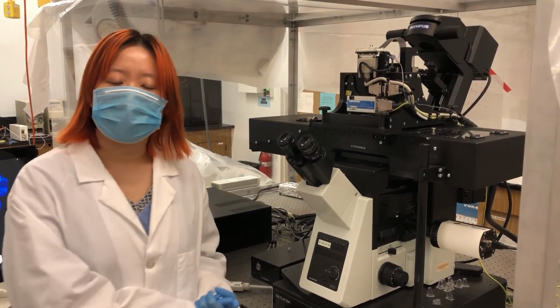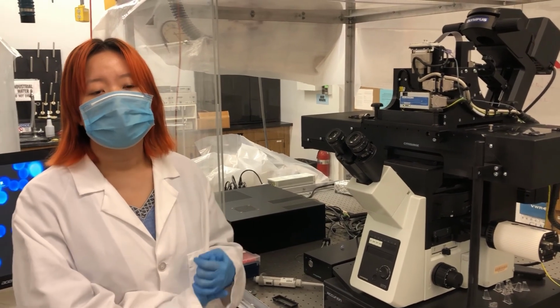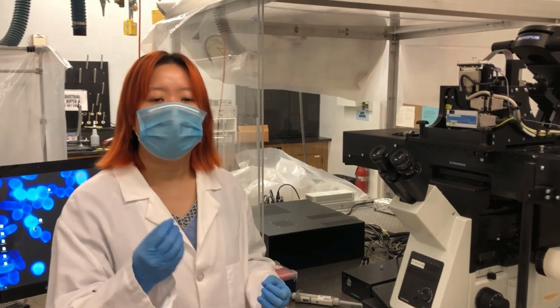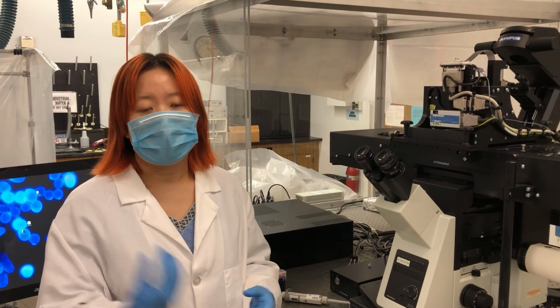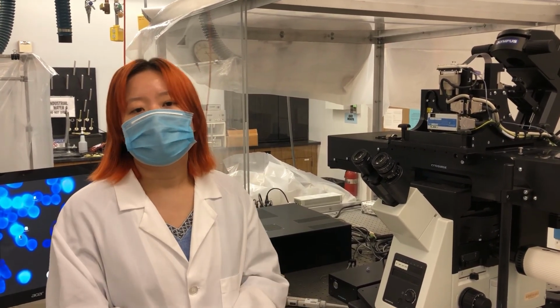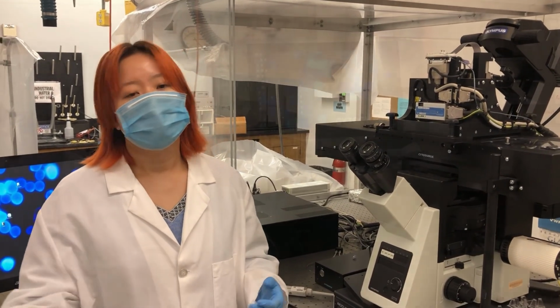It works like an AFM with a scanning probe. The only difference is we have tiny little openings in the apex of the scanning probes. So with those hollow FluidFM probes with apertures down to 300 nanometers, there are so many applications. There are bio applications. You can use it for 3D nano printing, you name it.